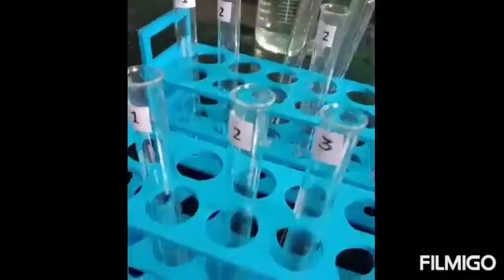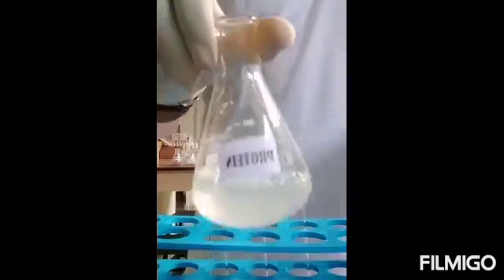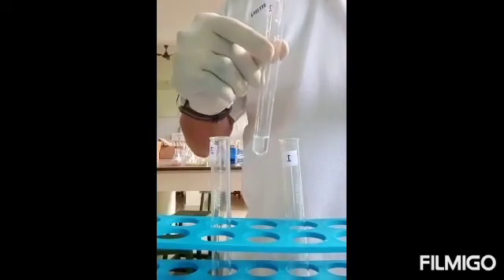Amino acid and protein give a positive ninhydrin test, while glucose is taken as a negative control. To the tube marked one, we are adding approximately 2 ml of amino acid. Since this is a qualitative test, we add approximately 2 ml of each solution — protein to the second test tube and glucose to the third test tube.